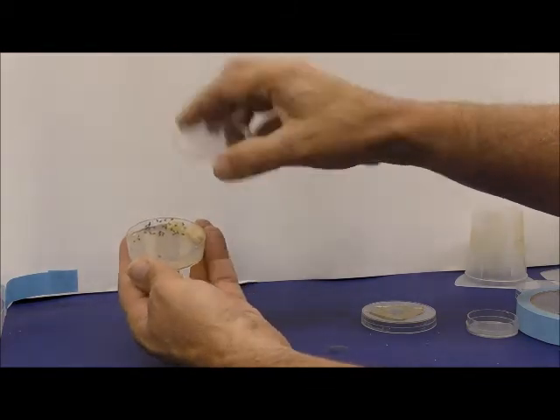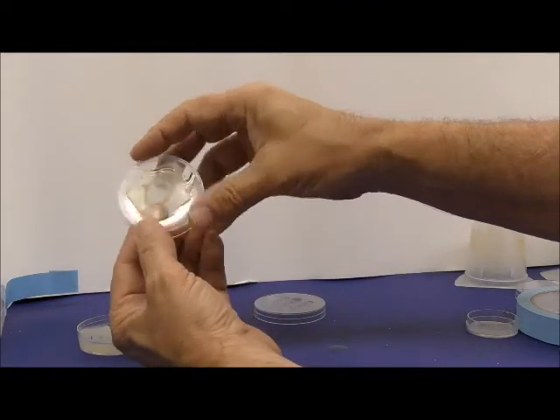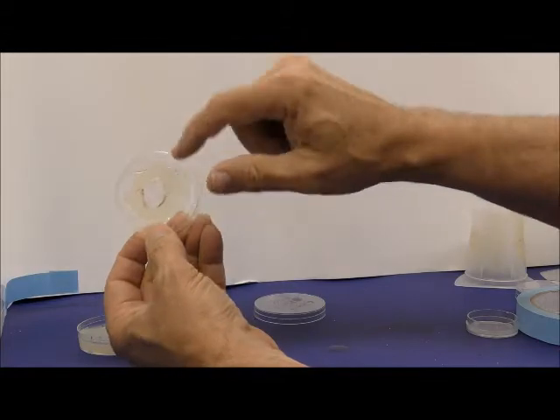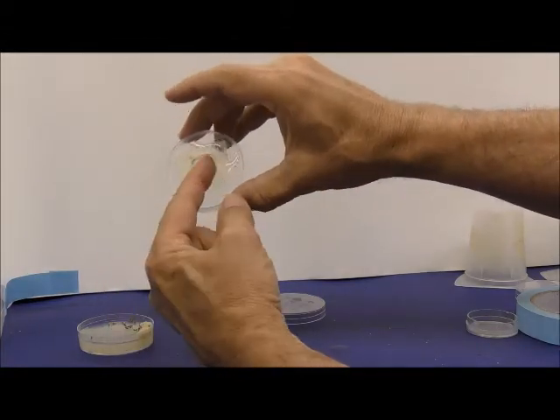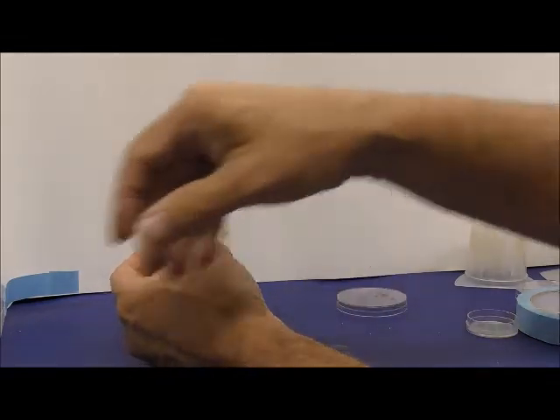So what we do is we take these lids, cut a hole in it with a soldering iron, and then we glue the netting. You can see the glue here. Now the netting allows air to go through. We put the lid on like that.